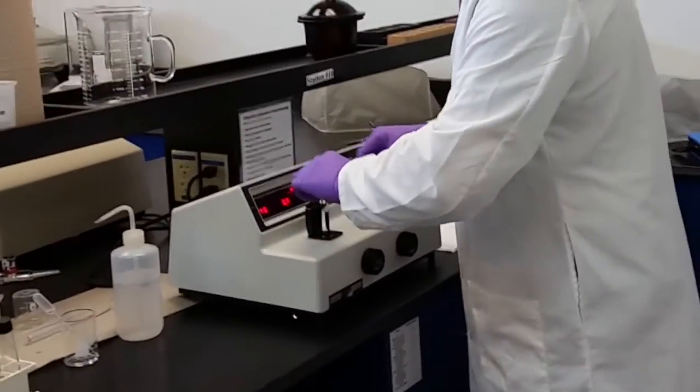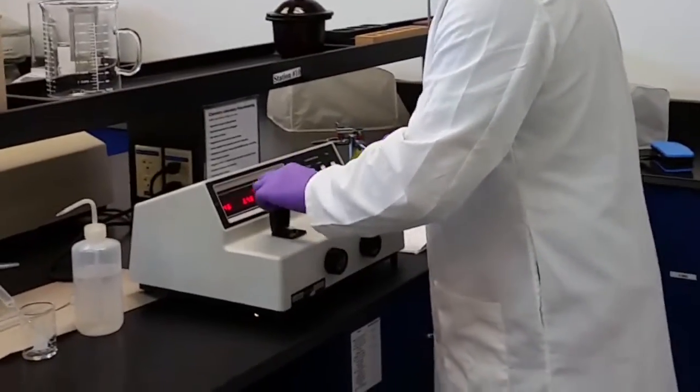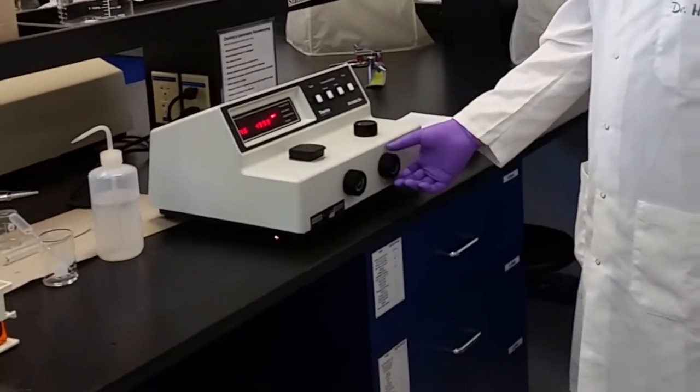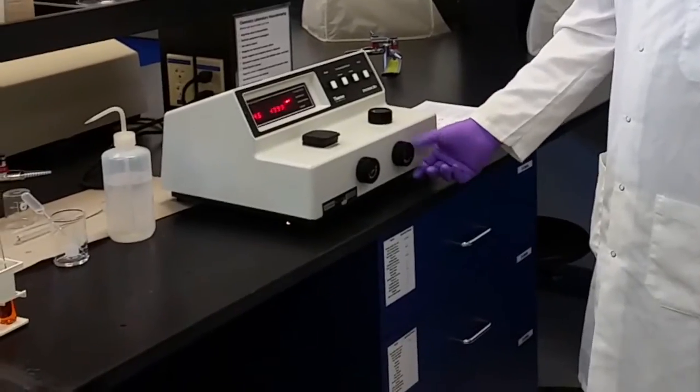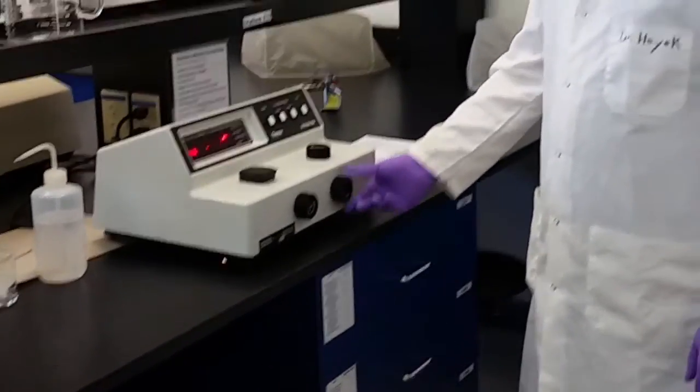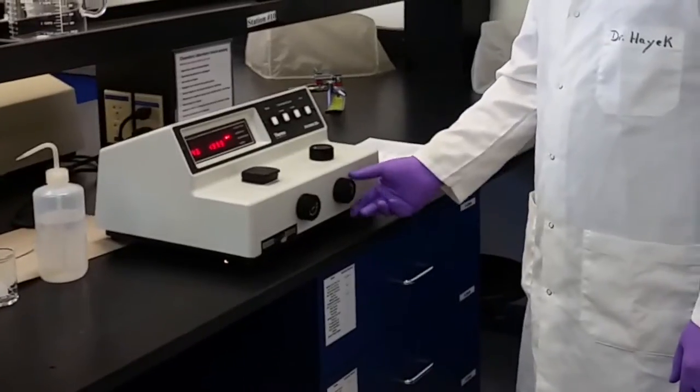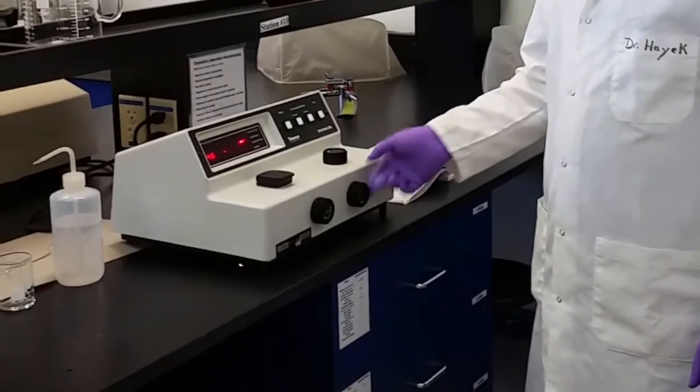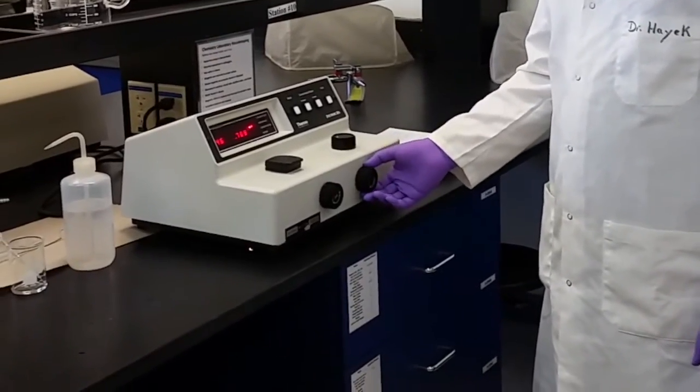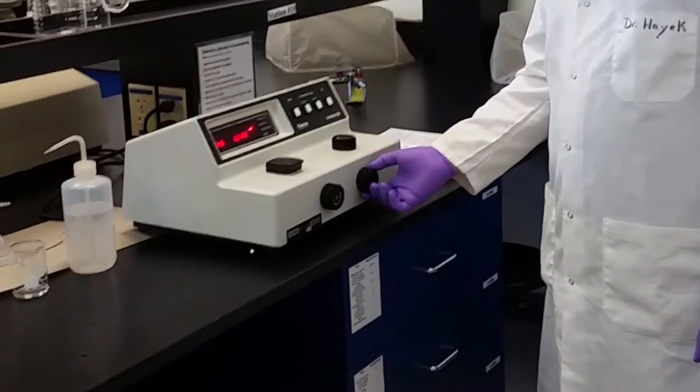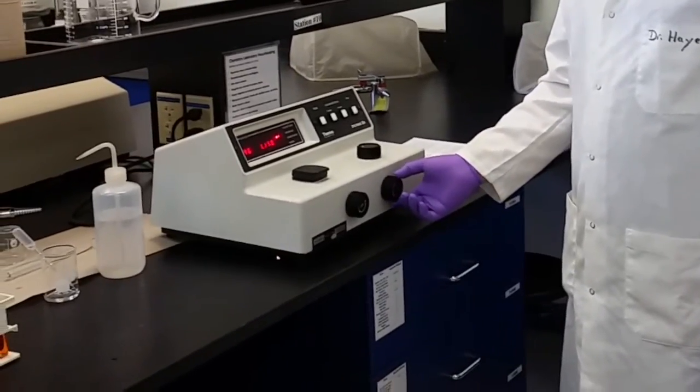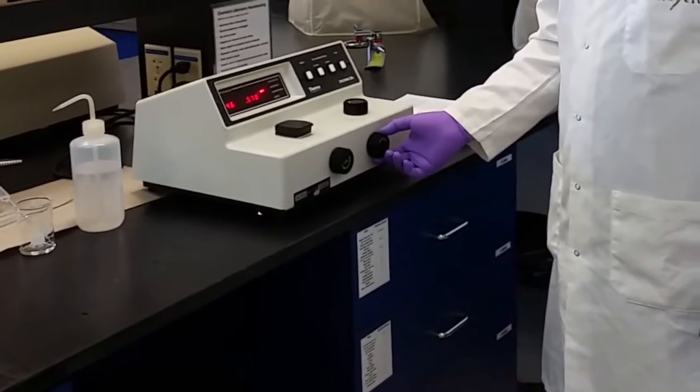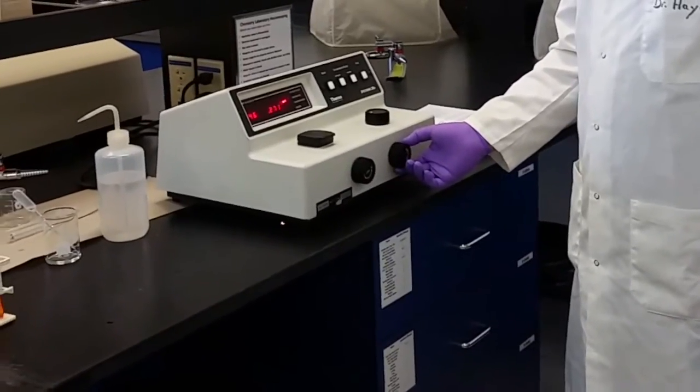Insert it in the spectrophotometer and change the mode to absorbance. Then use the 100% T zero absorbance dial to adjust it to 0. You might need to turn for a while until you see that the number is changing, then adjust it to 0.